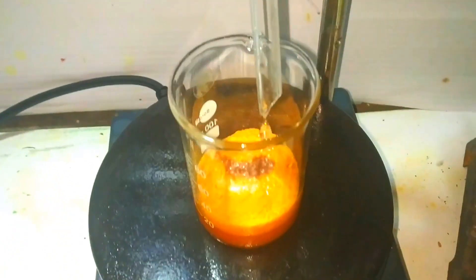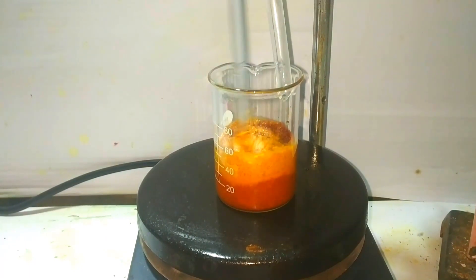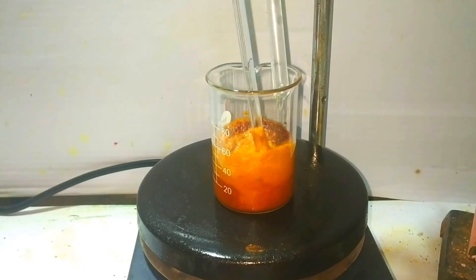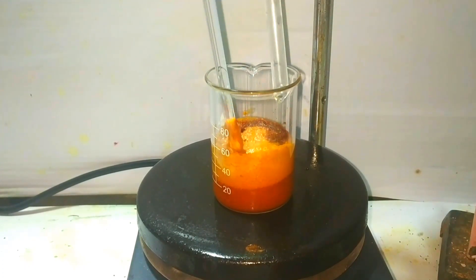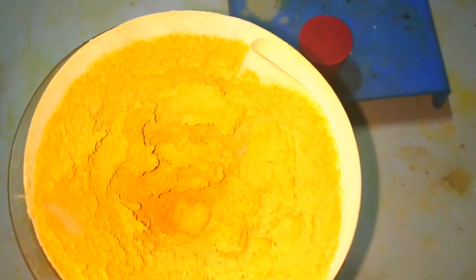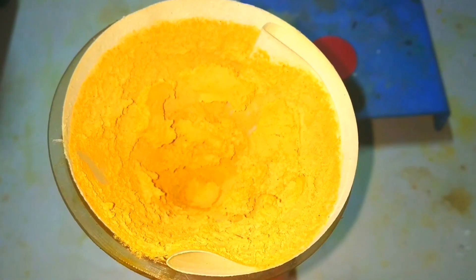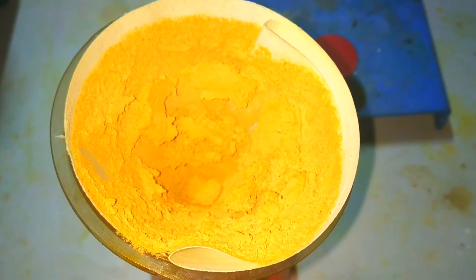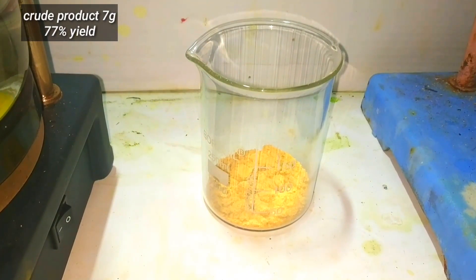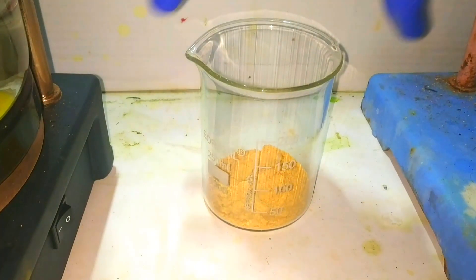Once the reaction is complete we move on to filtration. I am using a simple gravity filtration method, though vacuum filtration would be the best option. Once filtered, we let it dry — this is the crude paraiodonitrobenzene. You can easily recrystallize it using ethyl alcohol. I got a yield of 7 grams, which is around 77% of the theoretical yield.